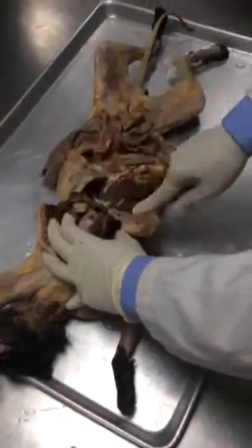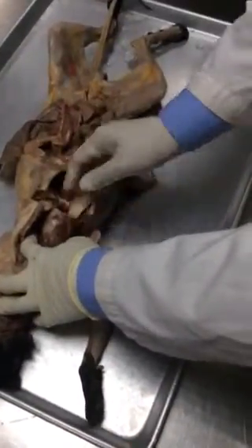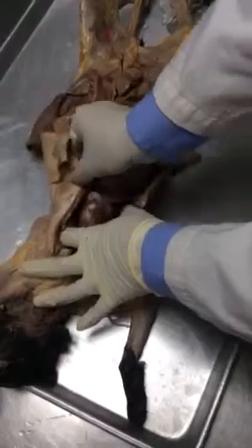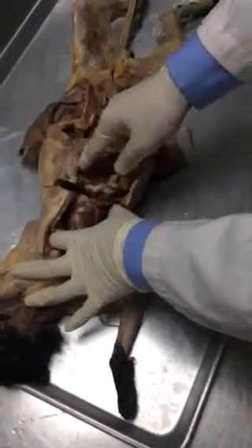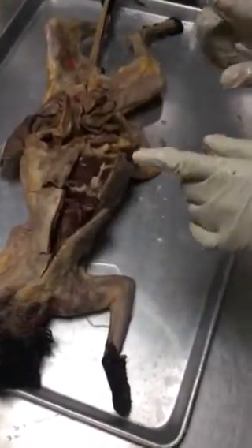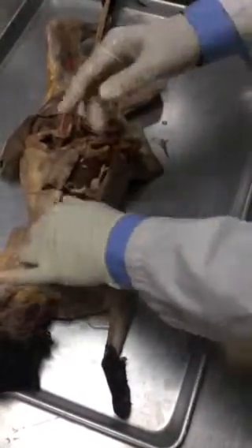So thorax. Where are the ribs? Ribs are here. Yeah, here you can feel them, okay? Whoever cut through the ribs. Okay. So here you see the diaphragm. Can you see the diaphragm? This is the muscle right here I'm feeling right now. This is the muscle called diaphragm, separating the thorax from the abdomen. Can you show it again? Yes, this is the muscle. Did you see the muscle? All right. And the thing is that this should not be the end. You should feel by yourself. All right, I'm showing you, but this is your job.